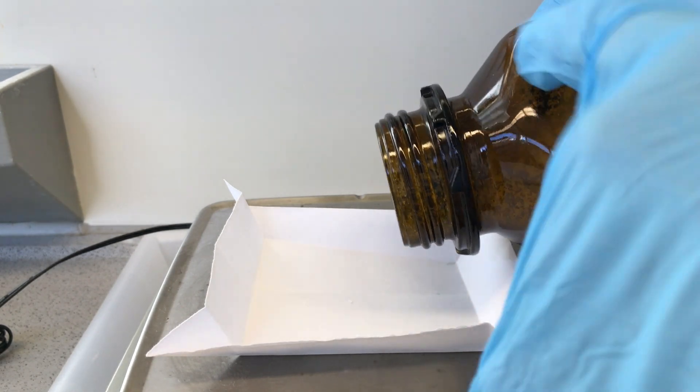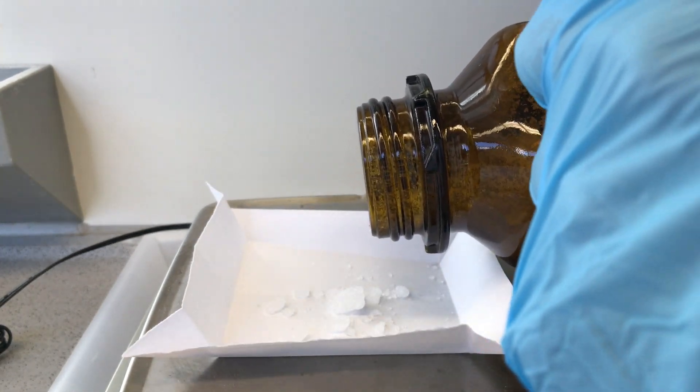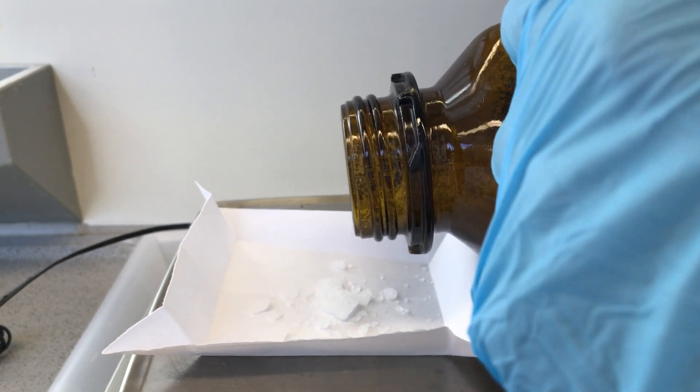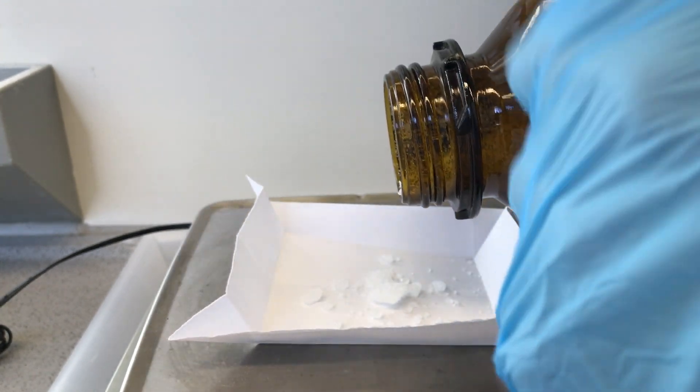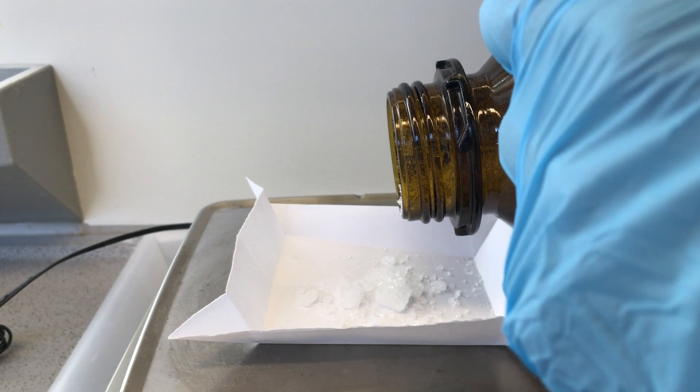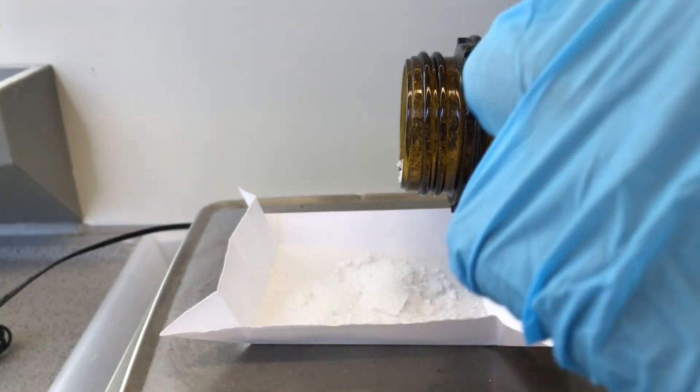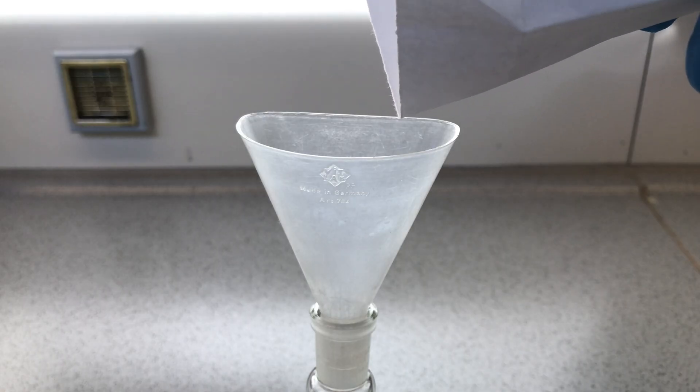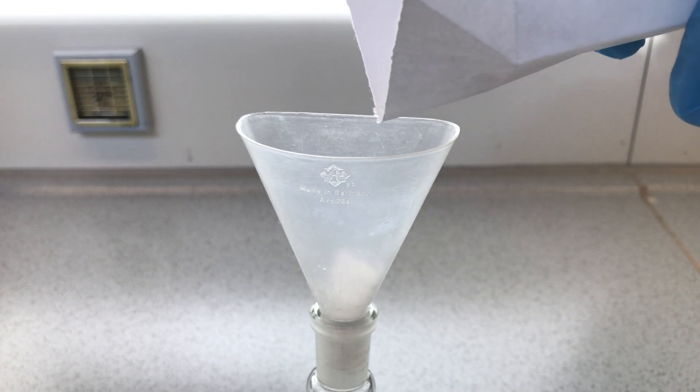To start off, I placed a paper weighing tray onto a scale and transferred 10 grams of chloral hydrate onto the tray. Chloral hydrate forms beautiful crystals. It also smells really nice—kind of reminds me of menthol but vastly different, but still good.